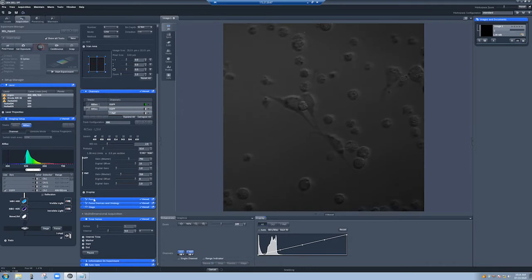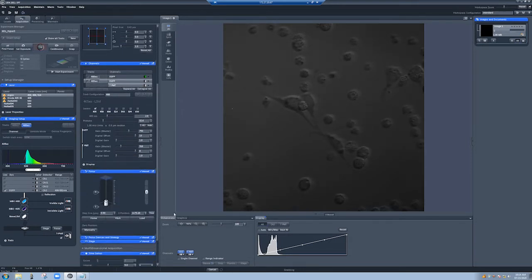This has fallen out of focus. So because I'm doing this remotely so I can record it, I'll have to adjust the focus with this focus knob here. Let's see if I can get that. Okay, I'm going in the wrong direction. There we go. Okay, so I'm roughly in focus now. I can stop the live imaging.